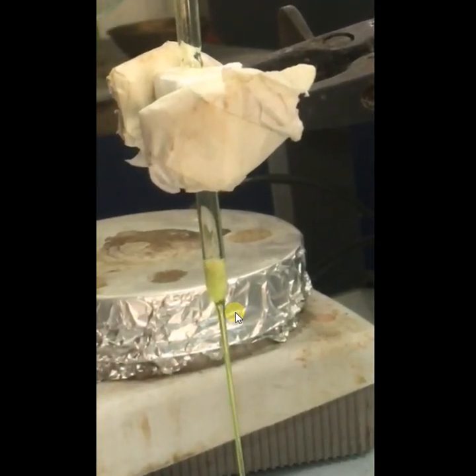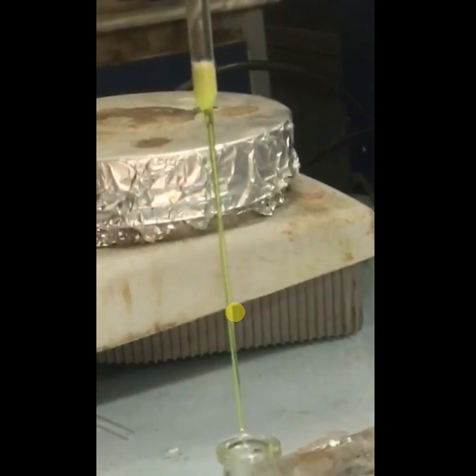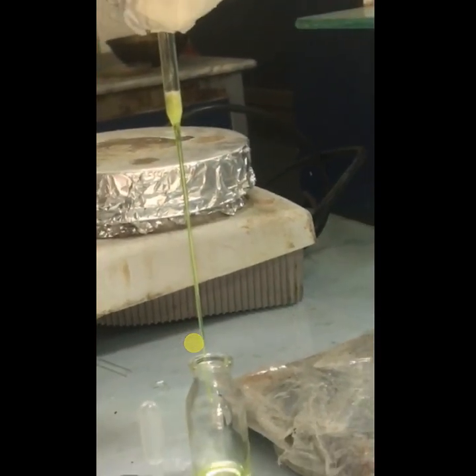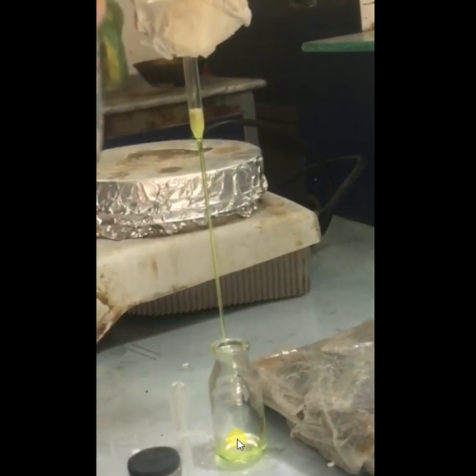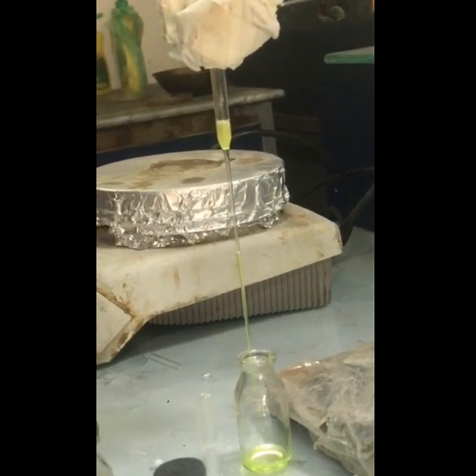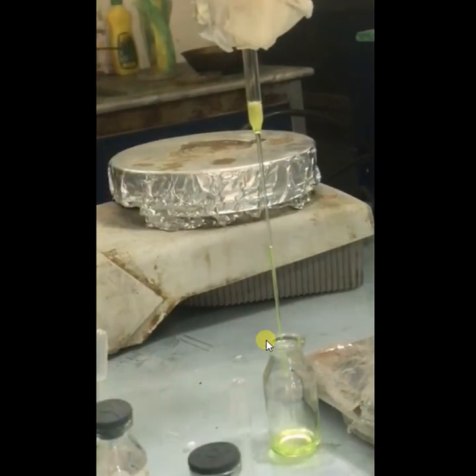I evaporated the solvent that I added. When the solvent evaporated, I took TLC again, and you will see that your sample is purified. My sample is purified and it gave a single spot. I did its NMR and the NMR was clear.